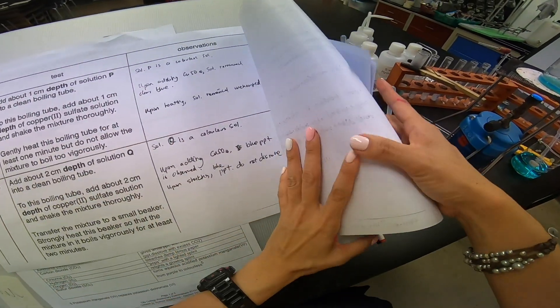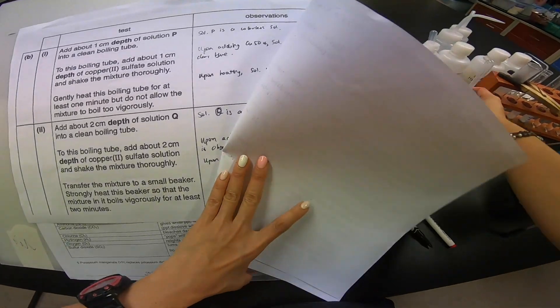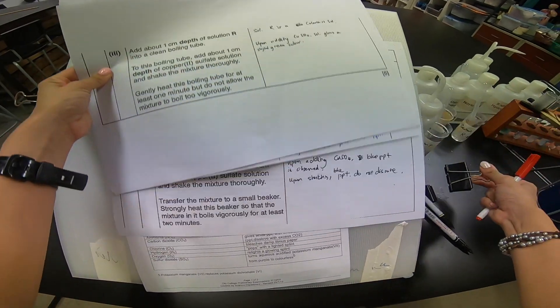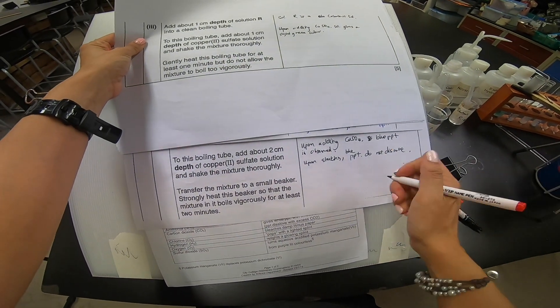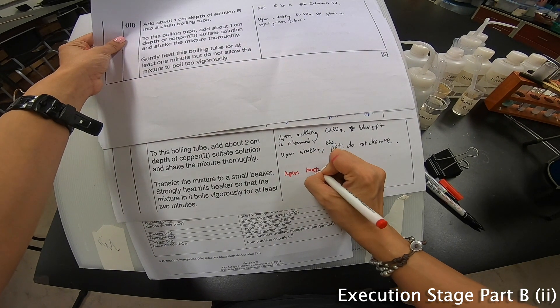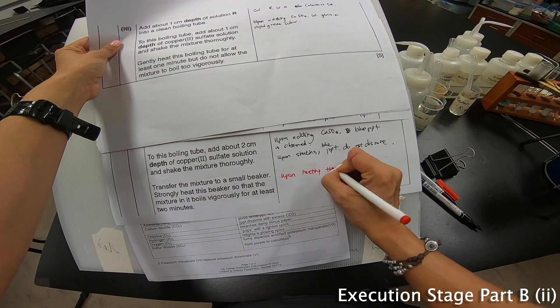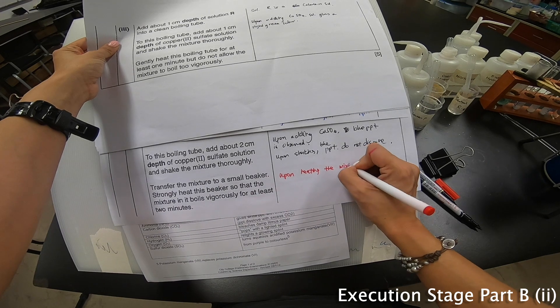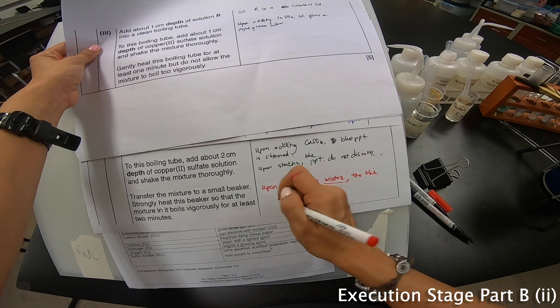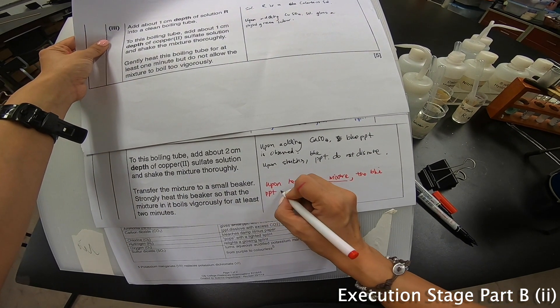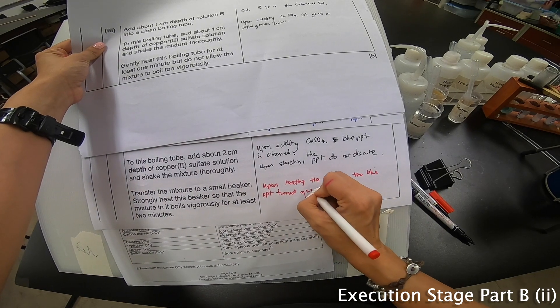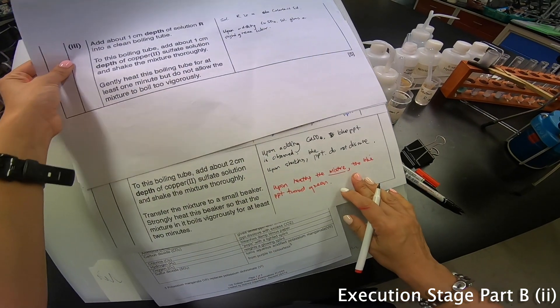So I'm going to use the camera and let you see right in the inside over here. It seems a little bit green. Can't you see? Now let's take a look at this one here for R. Comparatively these two solutions, this is a little bit dark blue and this one actually I feel that it looks a little bit slight green color solution. But because I'm supposed to heat it, let's heat it and see what color it changes. But this one I can say that upon heating it gives a slight green precipitate. So I'm going to add on this one over at this part.